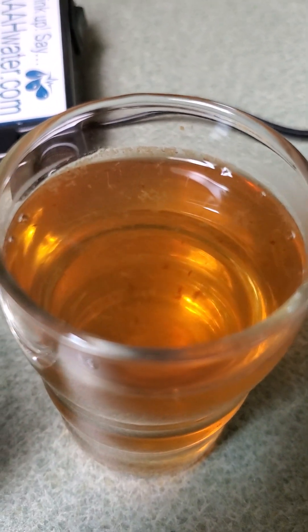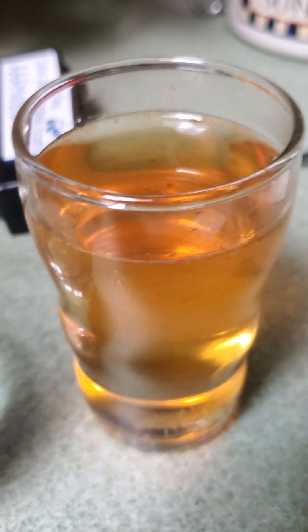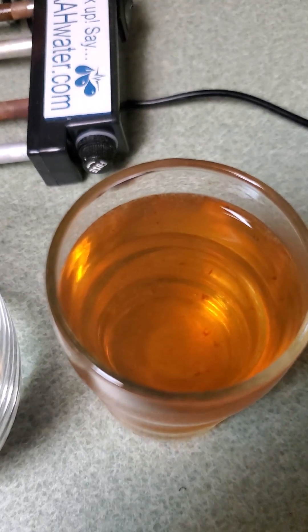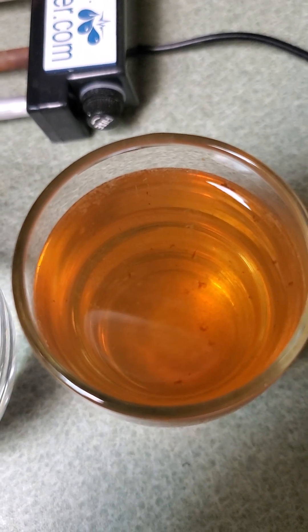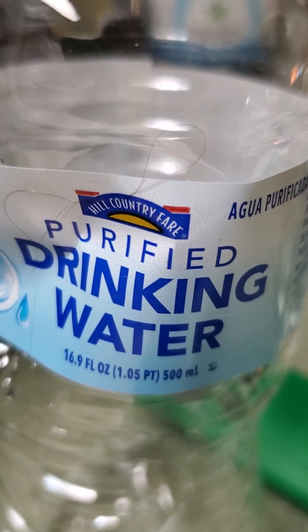Stopping the metals test — there is clearly a lot of iron in here. They talk about not using aluminum cookware, not using aluminum deodorant, and here we are with iron in drinkable potable water sold by Hill Country. Let me get the readings for you.